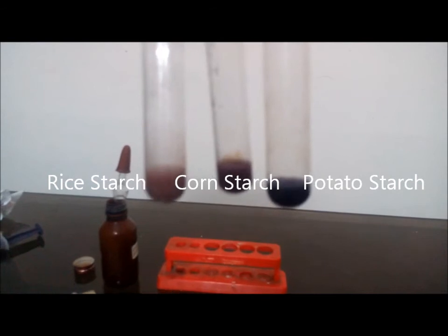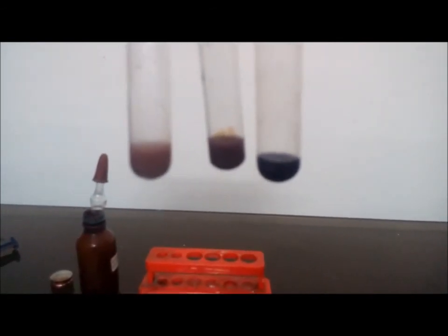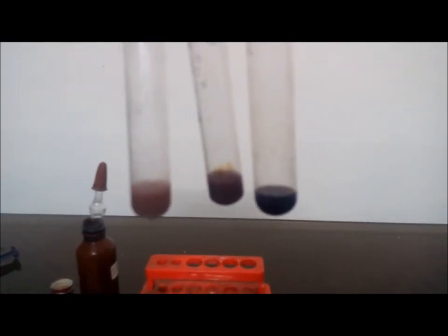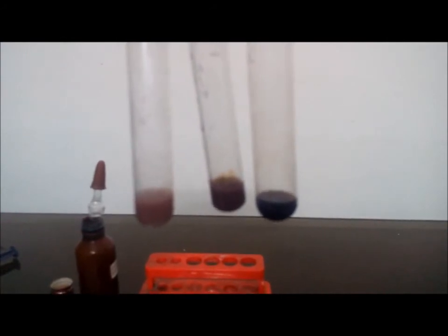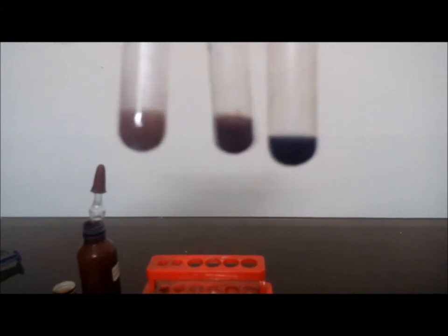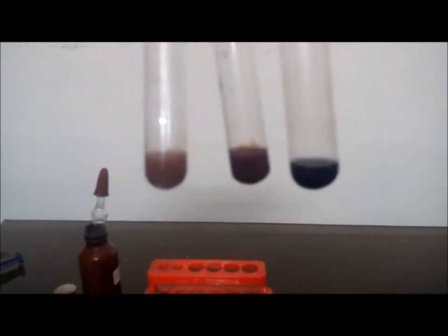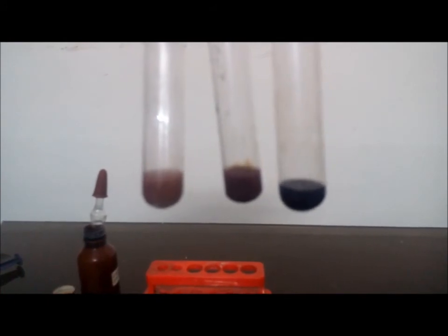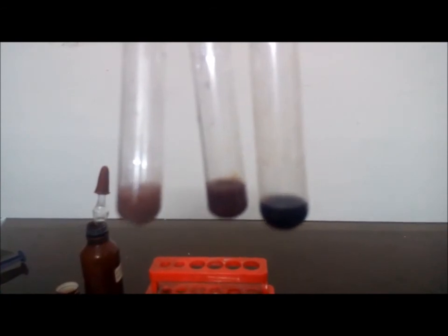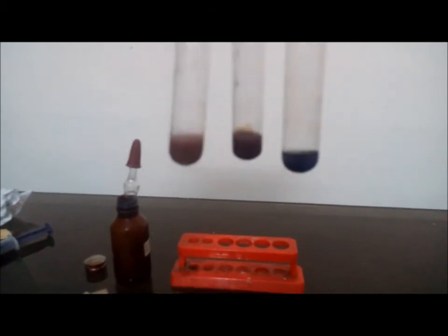So as I said, the iodine test is basically a test for amylose. A complex is formed between amylose chains and the iodine, so that gives the blue-black color. So we can say from this that rice starch has the least amylose, then it's the corn starch, and the maximum amylose content, having the maximum blue-black color, is the potato starch. So here, based on the intensities of the color, we just compared the amounts of amylose present in these three starches.